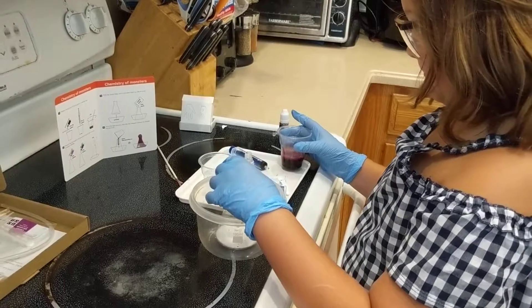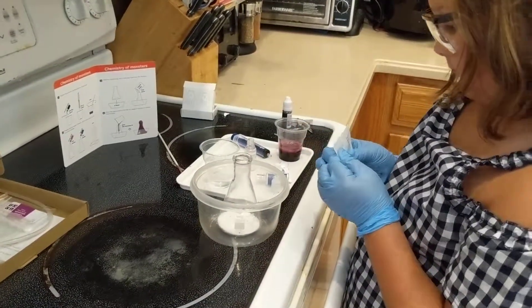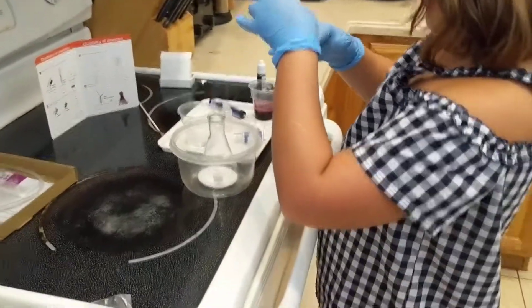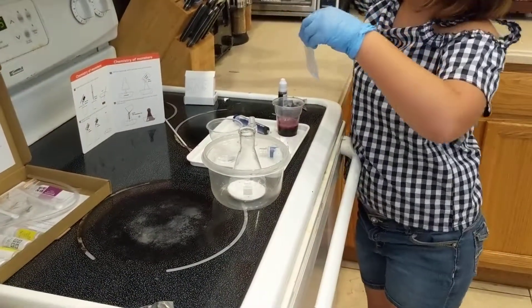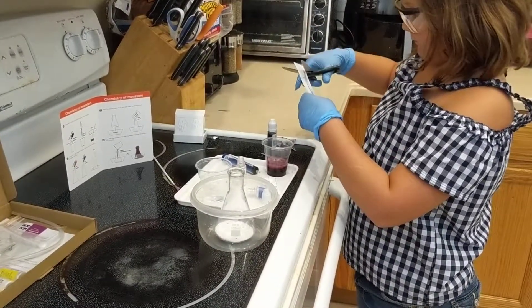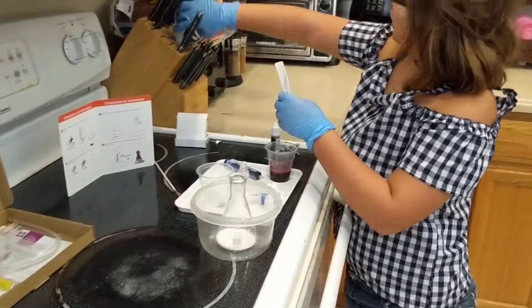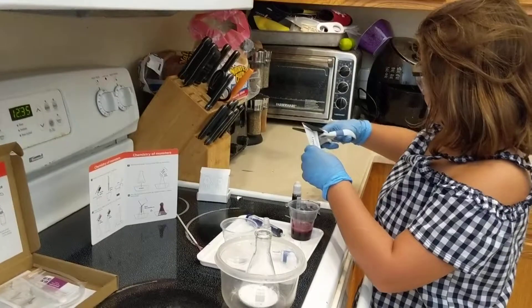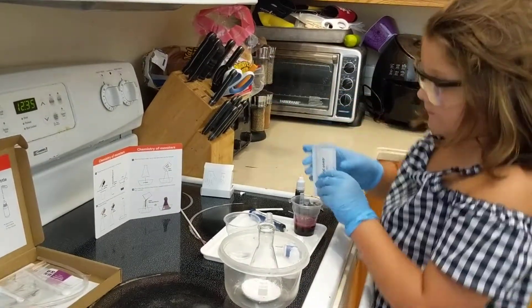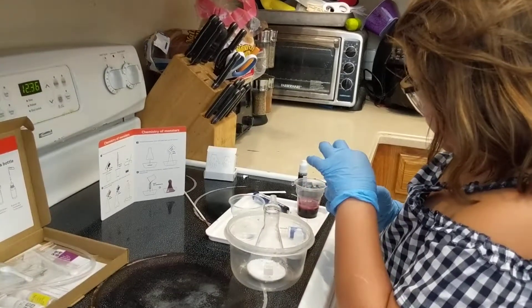I think that stays in the bowl. Nope, not yet. You gotta do the liquid soap goes into the flask. Use the white-handled scissors. Yeah, they seem to work better for that stuff. Yep, all of it goes into your flask.